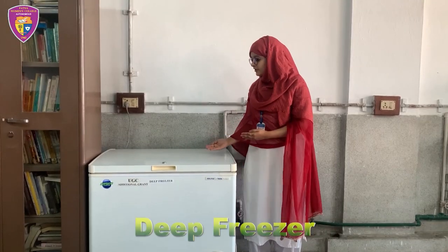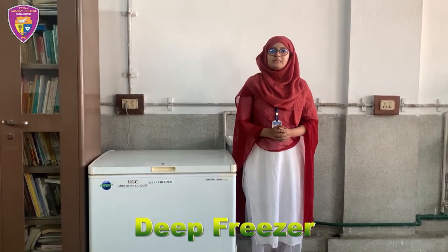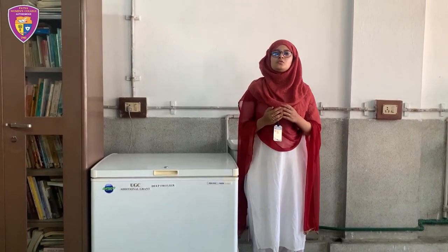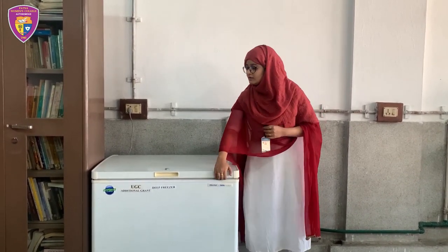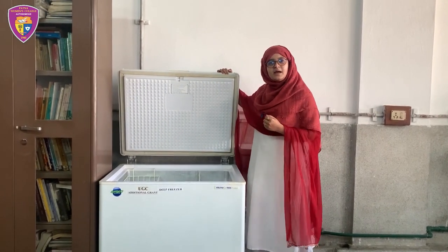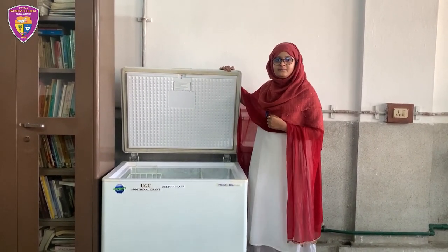Deep freezer. It is an equipment that maintains temperature ranging from minus 20 degrees Celsius to minus 80 degrees Celsius. It is used to preserve various types of chemicals and biological samples for a longer period of time.